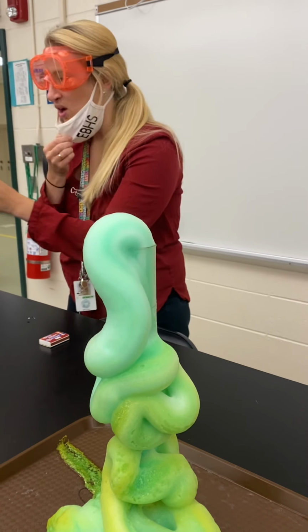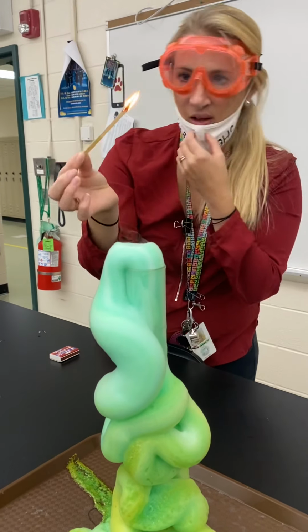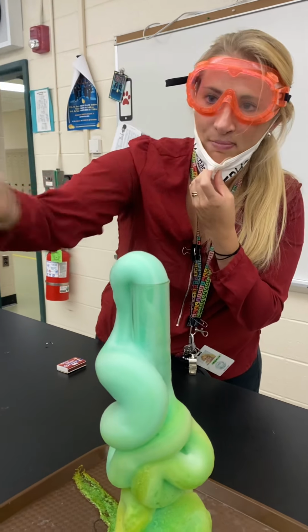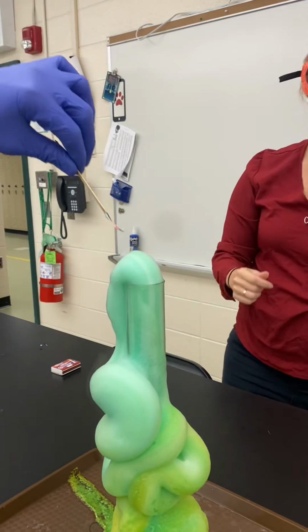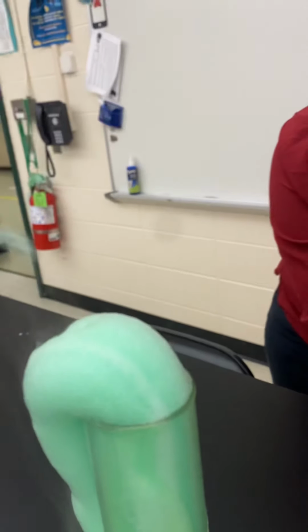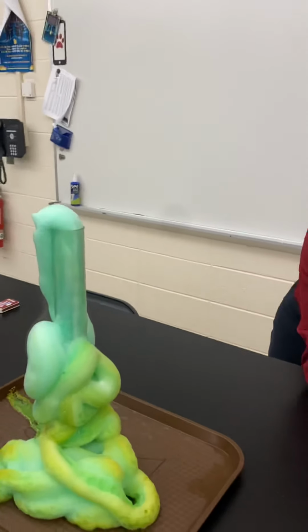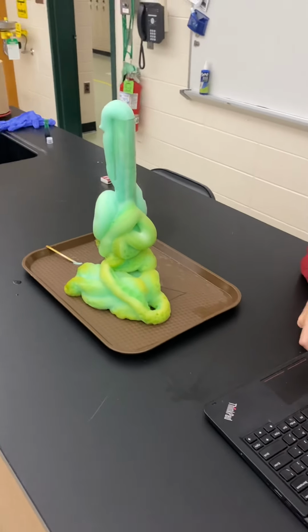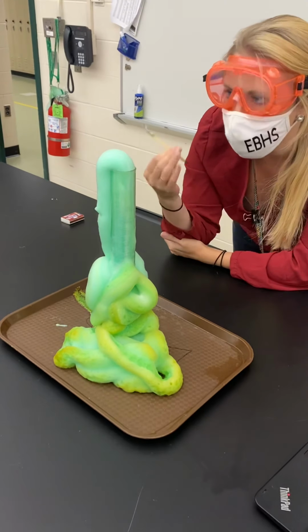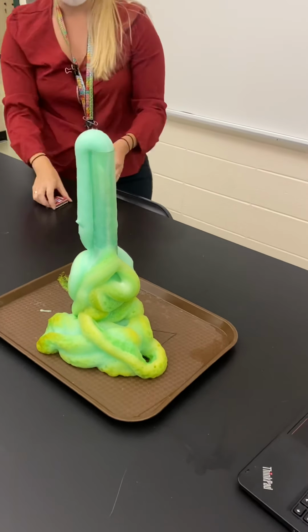It's changing color, it's drying up. You want the ember so that it relights. There you go. Now put it in and dip it in and pull it right out. You can see it relighting. Can you guys see that it lit up a little bit more each time? That's proving the presence of oxygen because you need oxygen to sustain a flame. So that's called the glowing splint test. So clearly there's oxygen present in it. Still coming out, still going. And that's it.